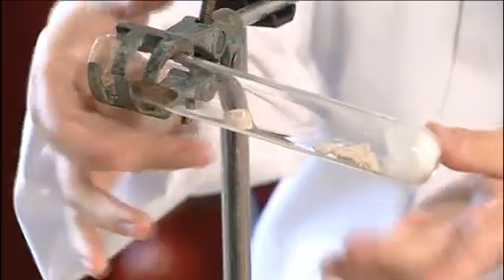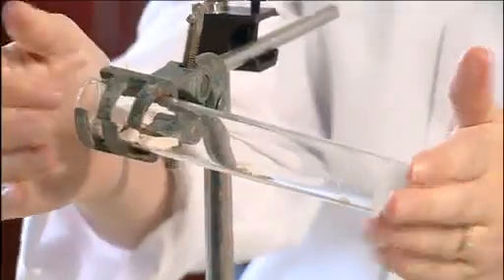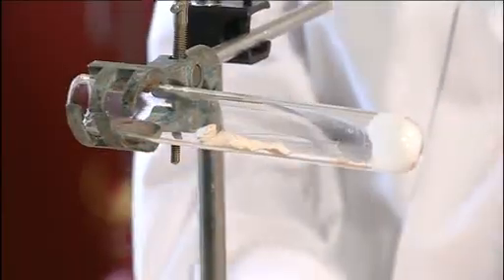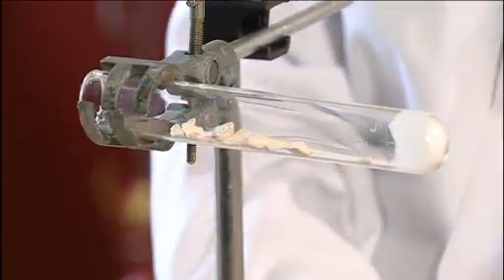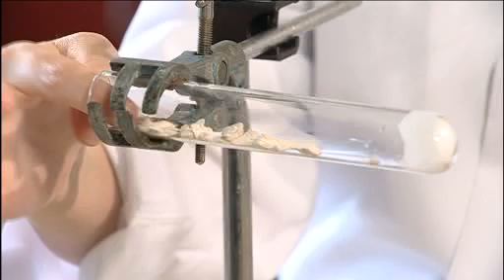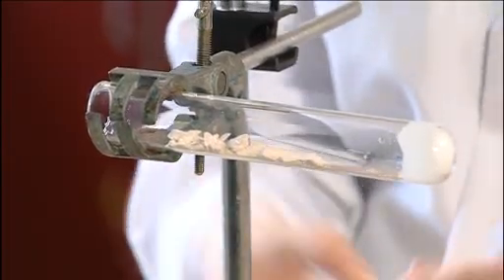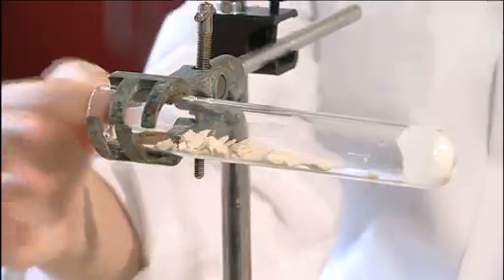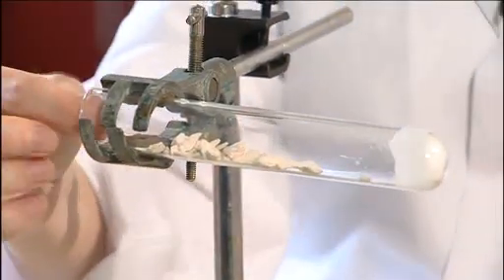Now you want this tilted but not so much so that all your catalyst falls to the bottom. This has got quite an open structure which gives you a large surface area for the reaction to take place on.